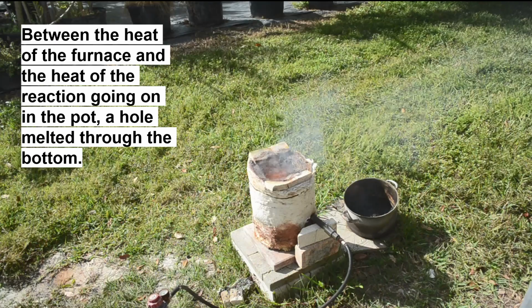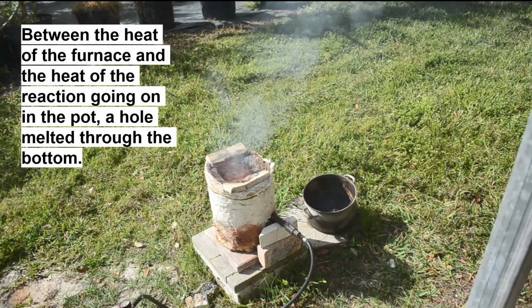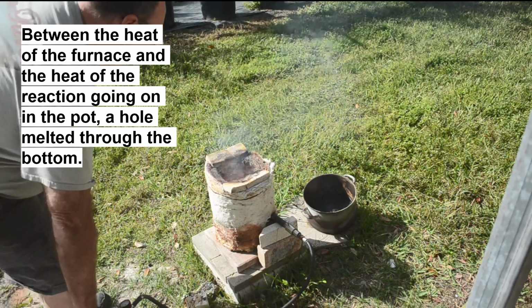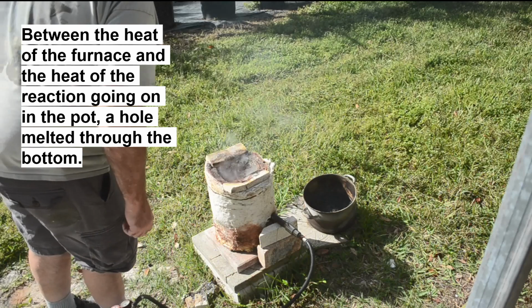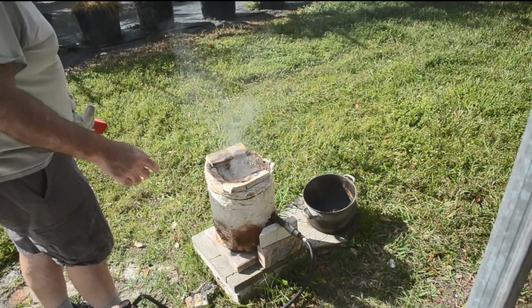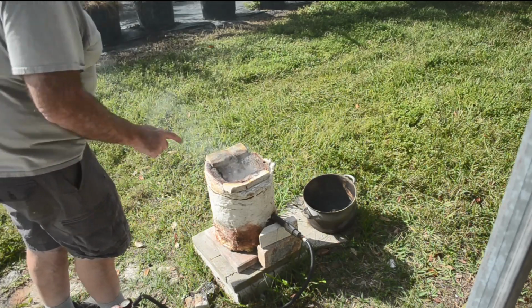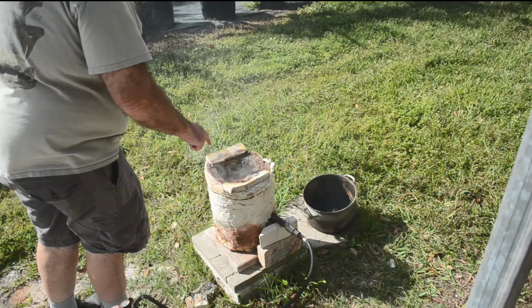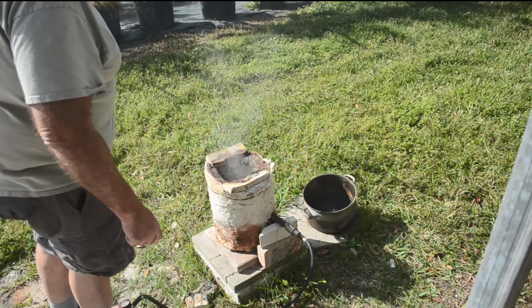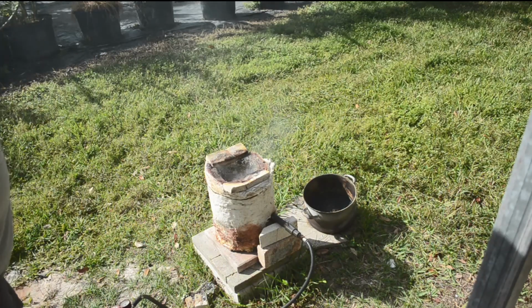Well, just had a bit of a disaster. Burned a hole in the bottom of my pan, and some of the material went down into the furnace, and boy did we have flames flaring up out of this furnace, let me tell you. Wow. Okay, so I will have to clean that out of there once everything cools down, add it to what's left in there, and yeah, then further process it.